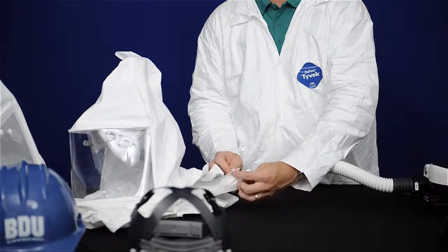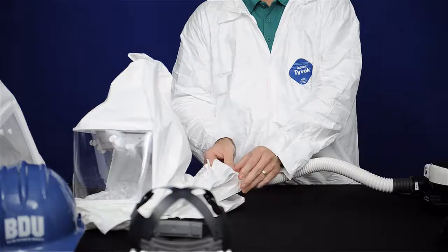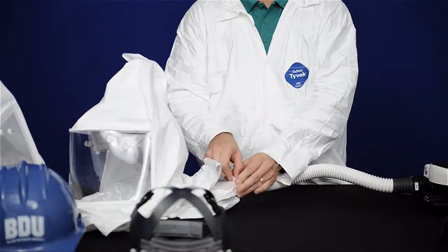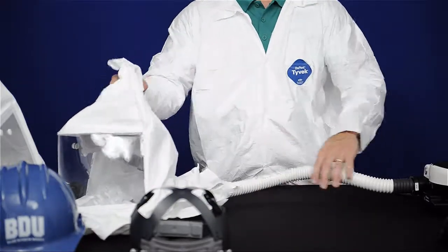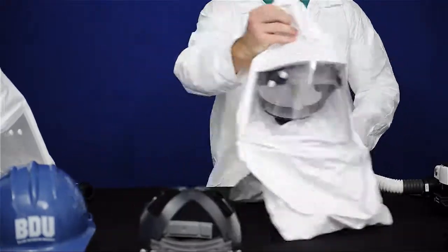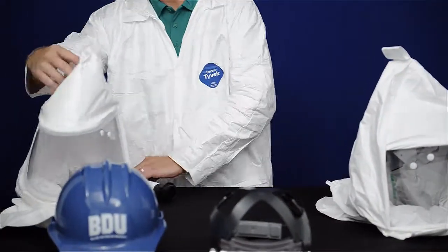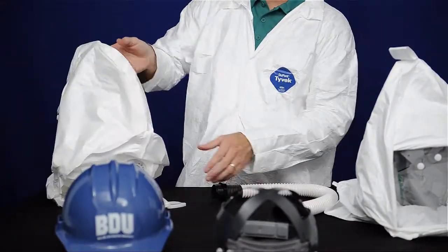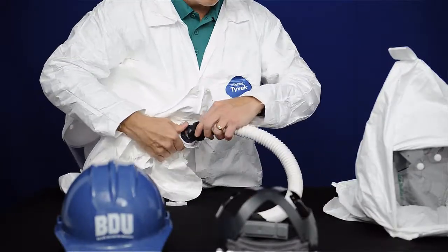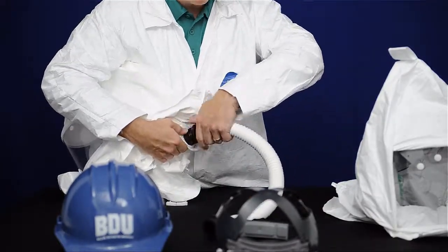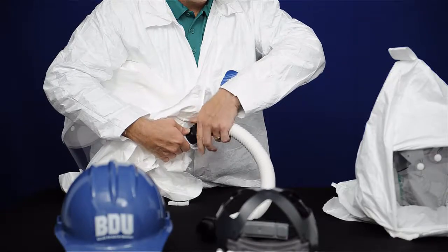Or if using a T series hood, thread the breathing tube into the corresponding connector on the rear of the hood. Hand tight is sufficient.